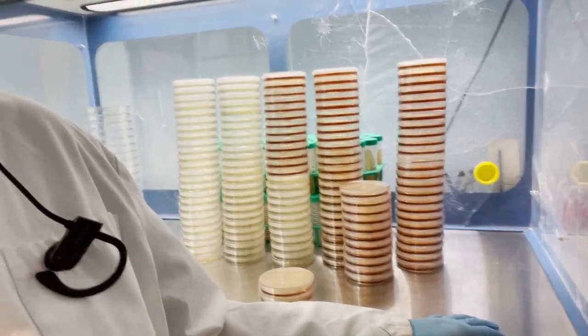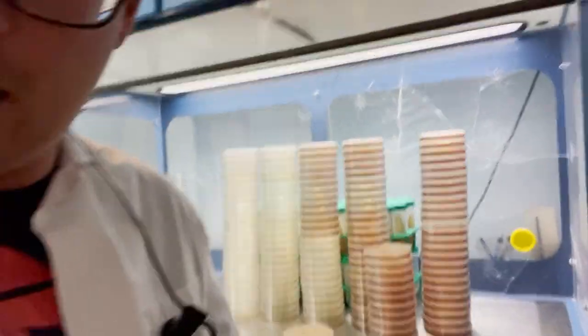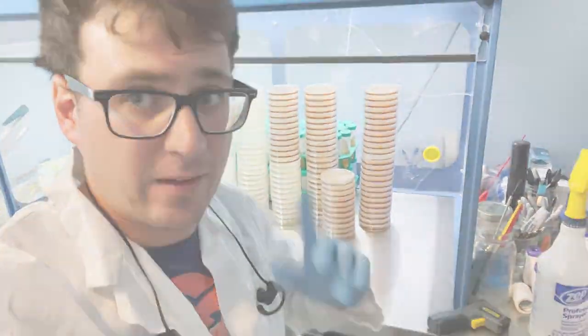All right guys, so I'm just going to let these dry overnight and sit for about 72 hours to QC them, and then they'll be good.